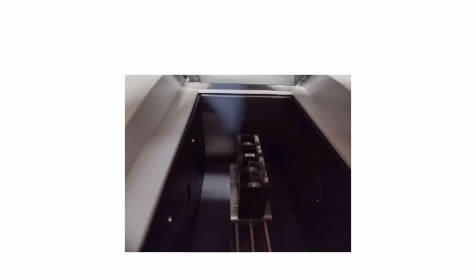And this just shows, if you can tell right here, the cuvette is in place. So that has a sample in it. You wipe down the sides with lens paper so you don't have any fingerprints that are going to interfere with it. So that is the setup for the spectrophotometer.